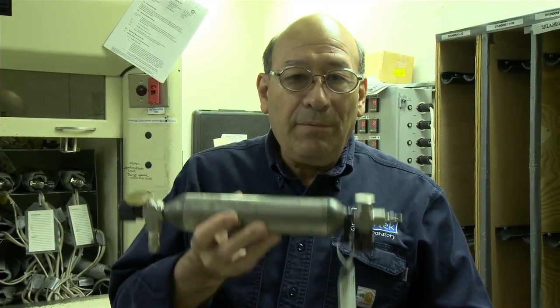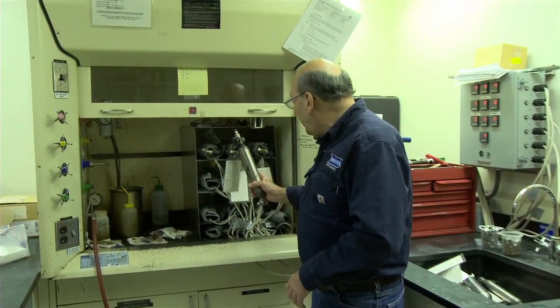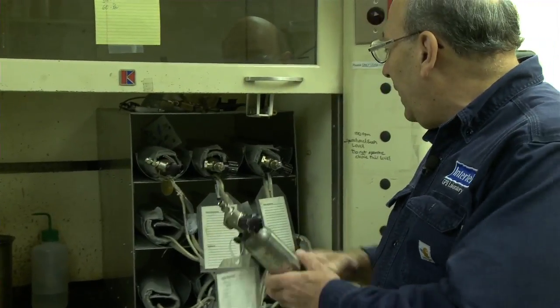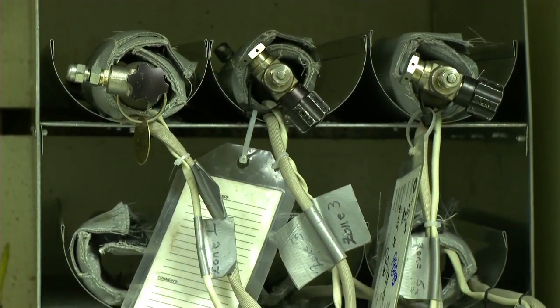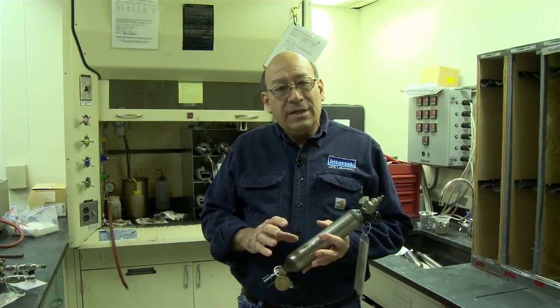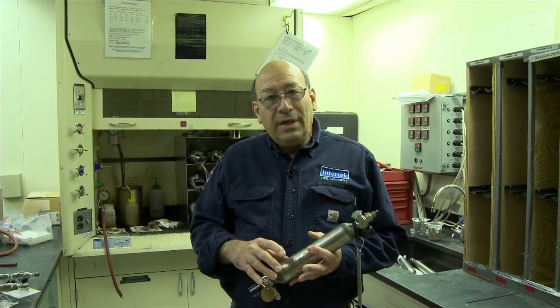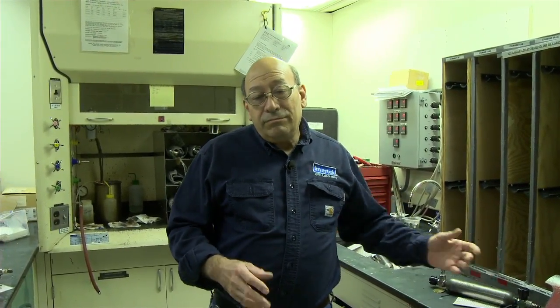From here, the sample is brought in after it's logged in, and it's placed in our area here for heating. The samples are heated in the heating pad for about 2 hours at 140 degrees. This simulates the temperature of the bottom hole temperature, or the test separator temperature as it comes out of the hole.